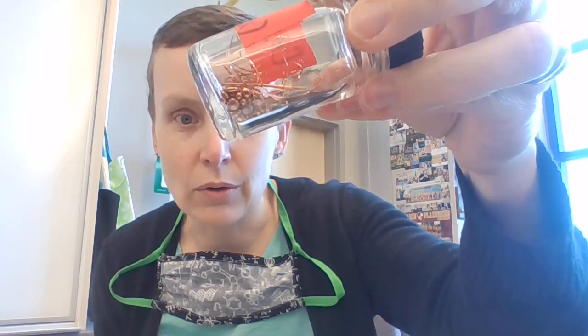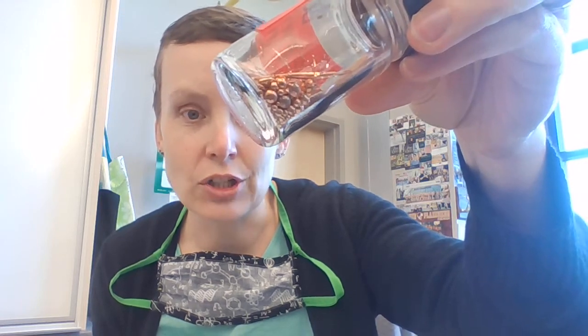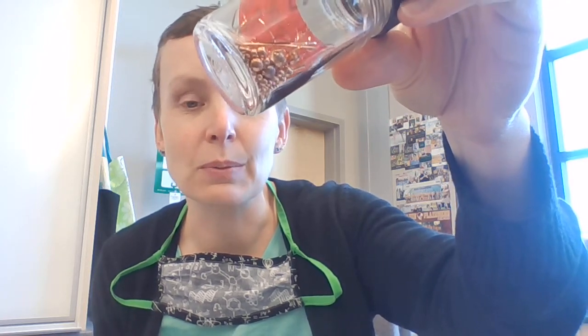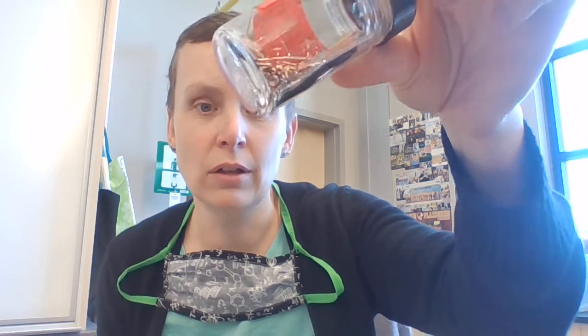So copper, you have seen copper when you look at a penny, for example, but this is what copper looks like. So it's a solid, and it's shiny. And then, you know what? I'm going to let you interpret the color. You could write copper colored. I mean, it's a pretty unique color. It is an orangish type of metal. Okay. So go ahead and write that description there.